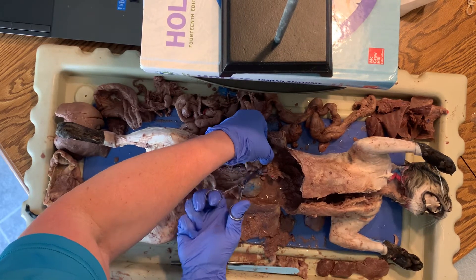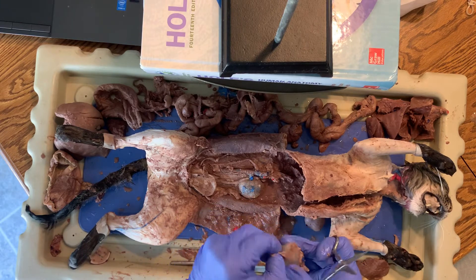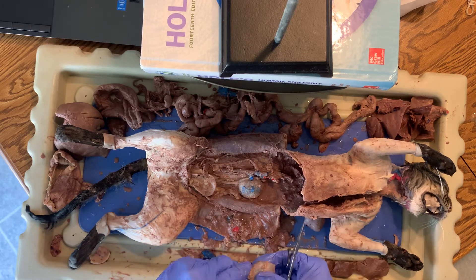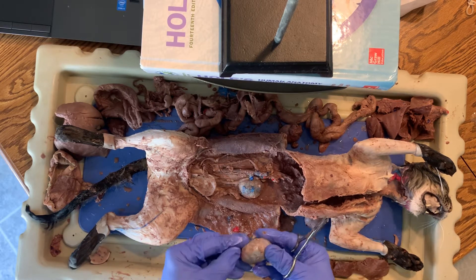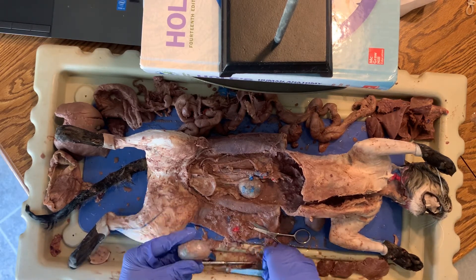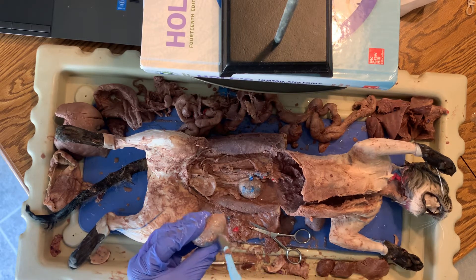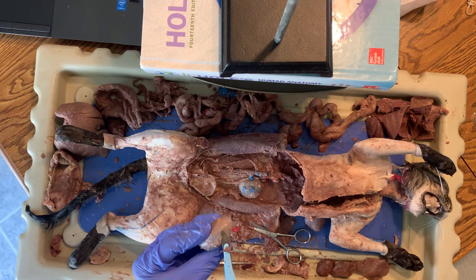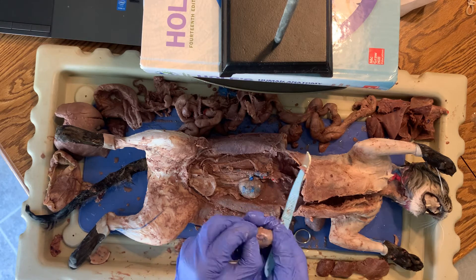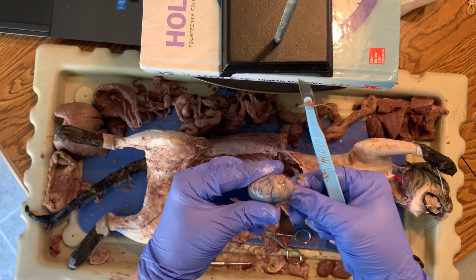If I separate it out here, you can see it's covered in a lot of that connective tissue — this time that would be the visceral peritoneum. That's right over the surface of it like a little bag, super super thin, but you can kind of see it coming off. Actually looks kind of pretty once you get it off.